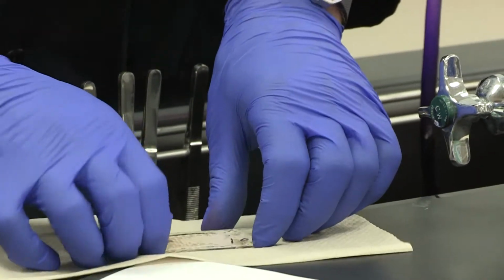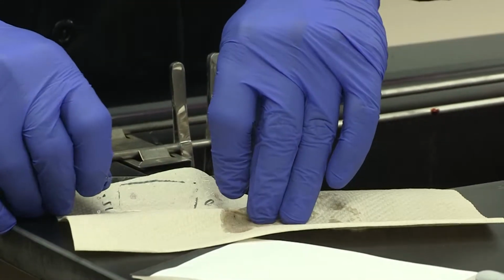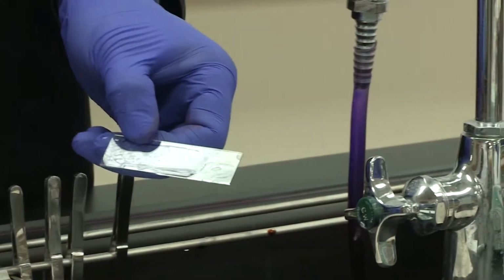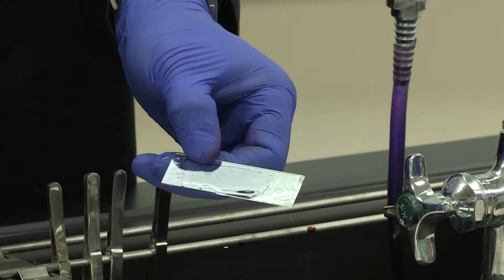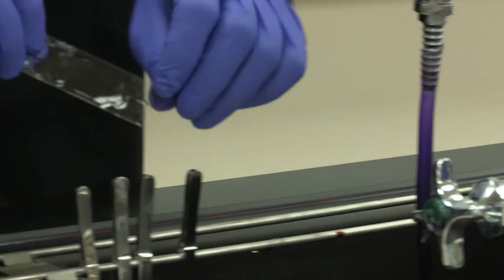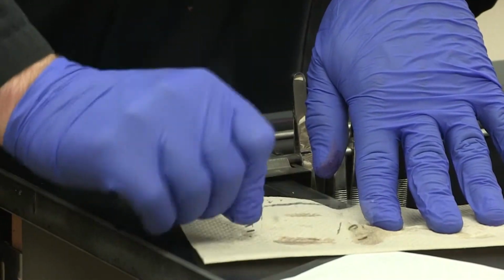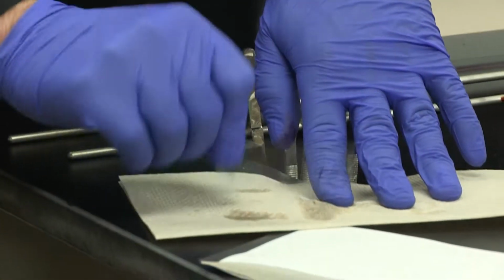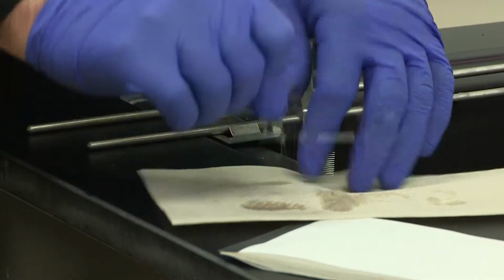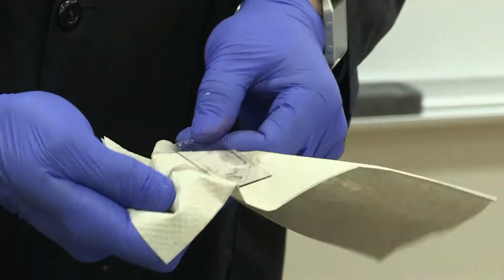So go ahead and dry off the backside. Very, very easy to dry off. Now, some instructors will tell you that you can lightly dab that water off. And if you're comfortable doing that, you may, but lots of students have trouble with dabbing and they'll wipe off their bacteria. So instead of dabbing, I recommend to lightly tap the slide. That will concentrate the water towards the bottom of the slide, whereas you can simply wipe the bottom of the slide because that's not where your bacteria is.